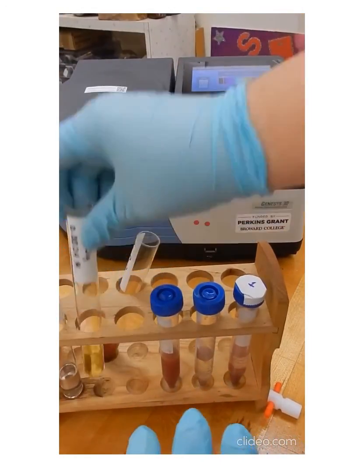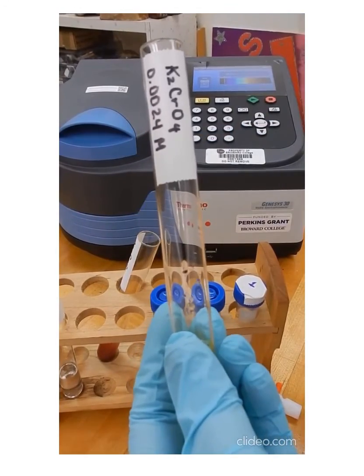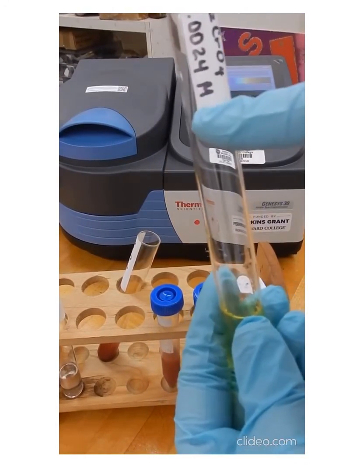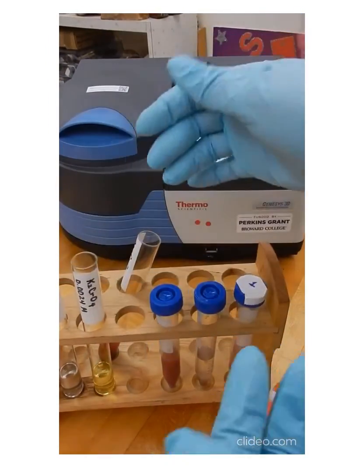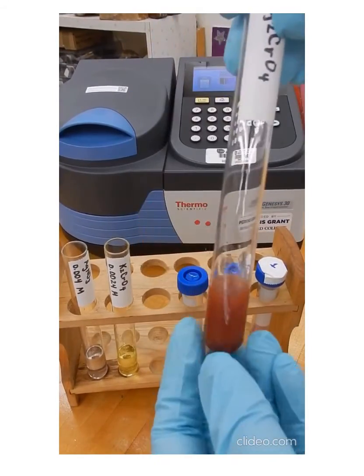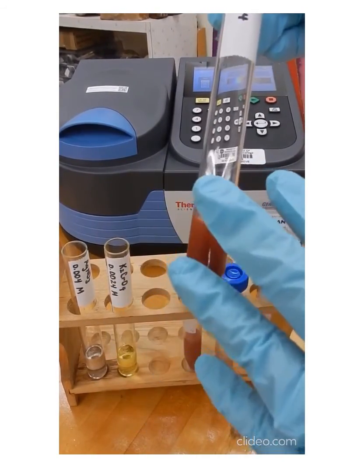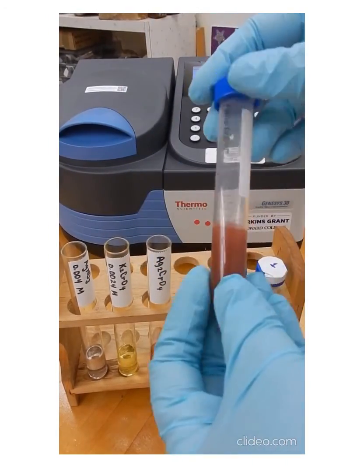And now we have our solution here for the potassium chromate, which is the one that we used to prepare the calibration plot. Also, you have the concentration for the potassium chromate solution that we're using. It's right here in the label. When we mix these two solutions, which are aqueous because both compounds are soluble in water, we get our insoluble compound, silver chromate. So this compound that we're forming here is a solid, and we're transferring that one into a centrifuge tube.